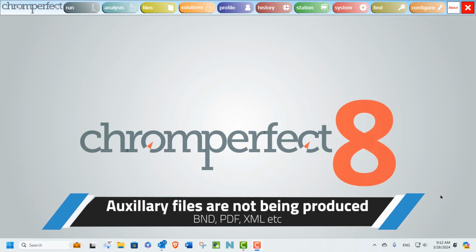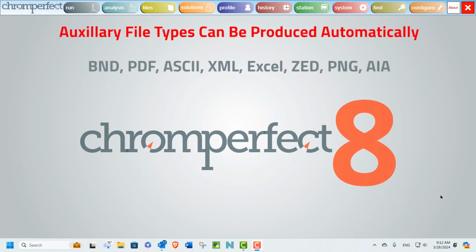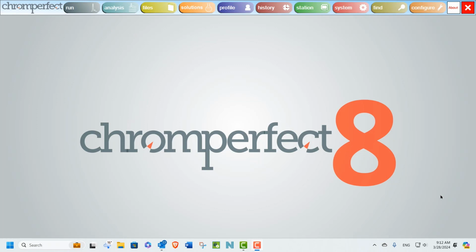In this video, we're going to look at a common technical support question received by users of the Chromperfect chromatography data system. Chromperfect can produce several different file types at the end of every analysis. These include reports in PDF format, graphic files, as well as a number of data file formats. Occasionally, users report that these files do not appear as expected.